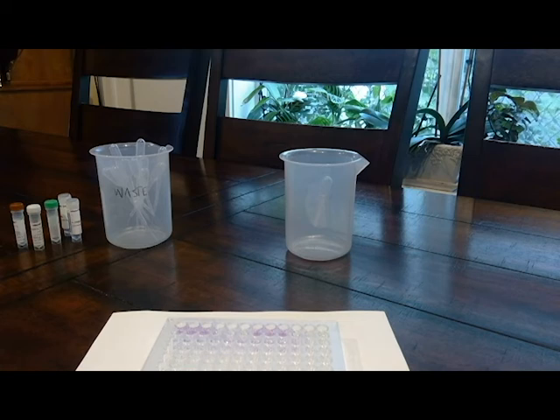So now that we're done, we'll need to deal with disposal and cleanup. This doesn't have any real serum samples or antibodies, and so disinfection is not required.